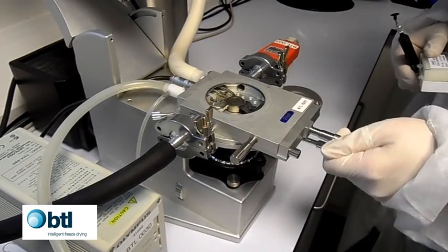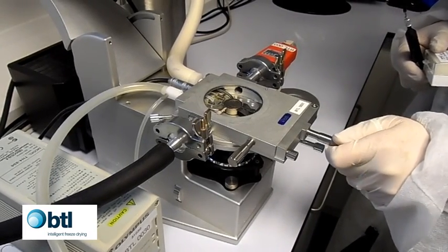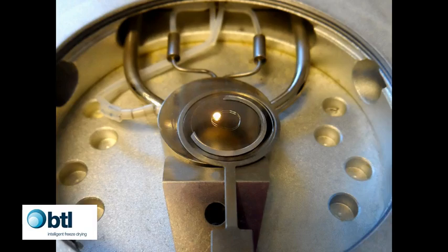Using the X and Y manipulators, move the sample holder until the edge of the sample is over the light source so that you can track progress of drying from the outside in.